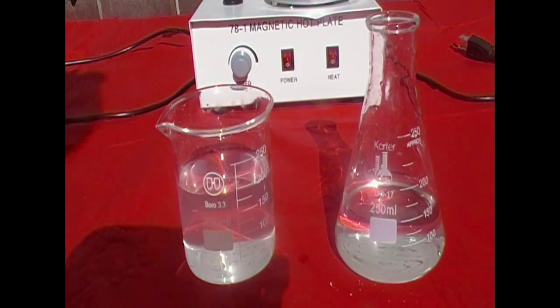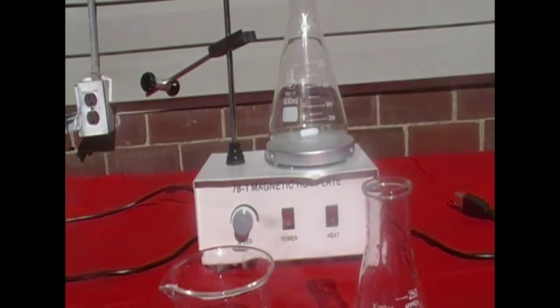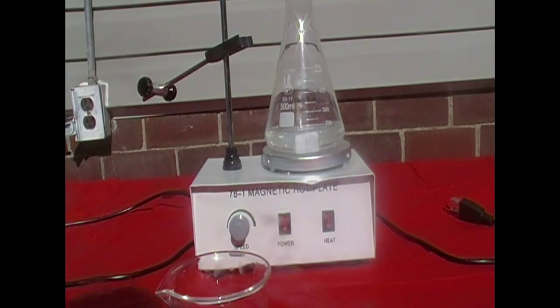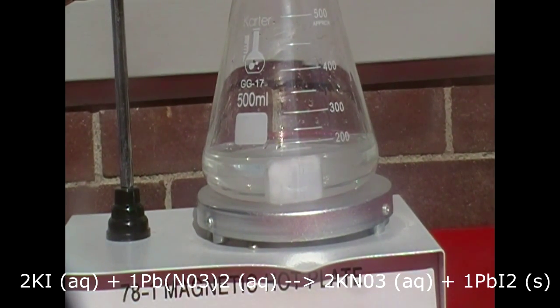Now that they've both dissolved, I'm going to mix both of them in a slightly larger Erlenmeyer flask on top of my hot plate / magnetic stir. Now I'm going to put the potassium iodide mixture in first, because this is usually how I do it, and then I add in the lead nitrate the second time, because it tends to get everywhere once they mix together, and it gets very hard to take the lead off of the flask, so this just makes it a bit easier for me. And now we're going to see what happens.